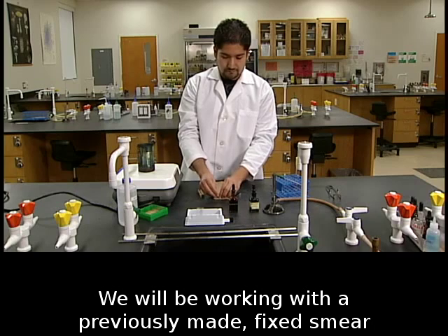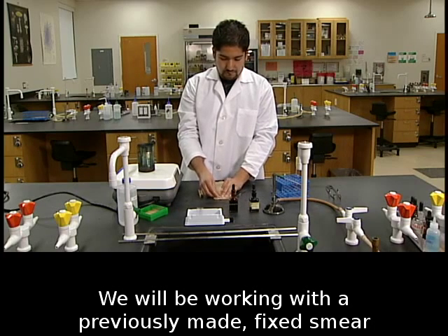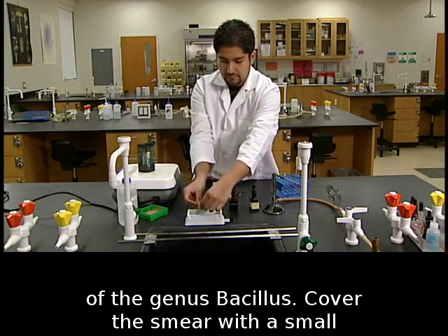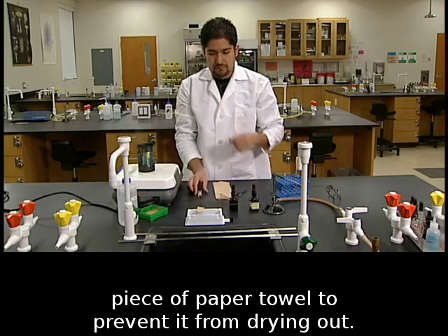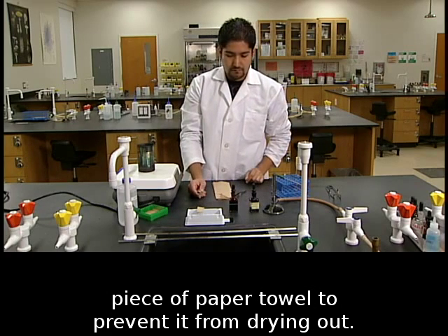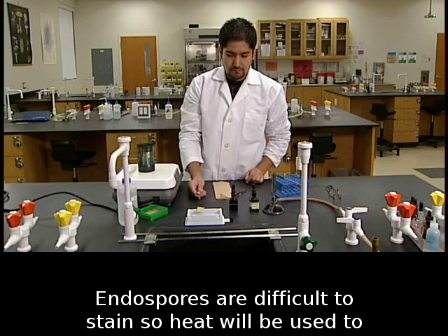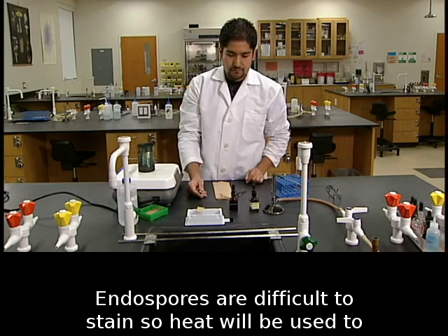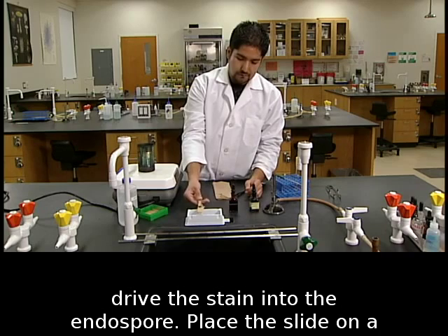We will be working with a previously made fixed smear of the genus Bacillus. Cover the smear with a small piece of paper towel to prevent it from drying out. Endospores are difficult to stain, so heat will be used to drive the stain into the endospore.